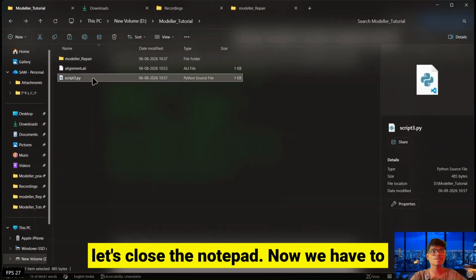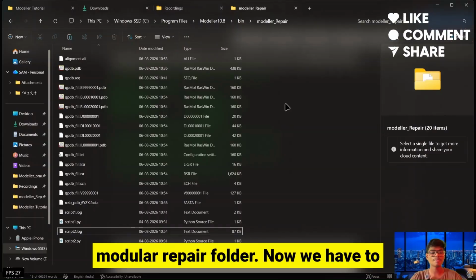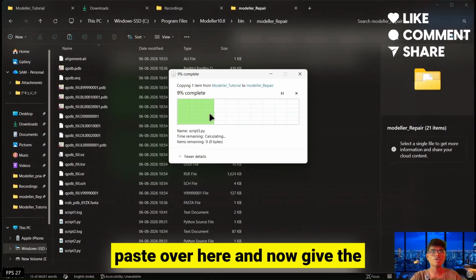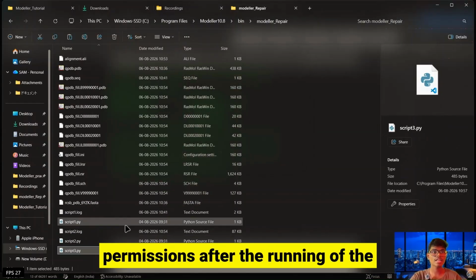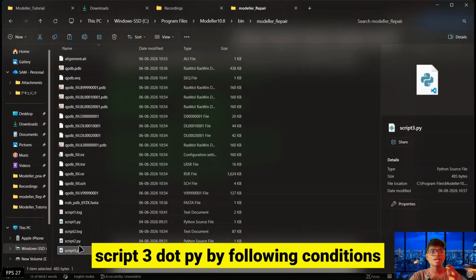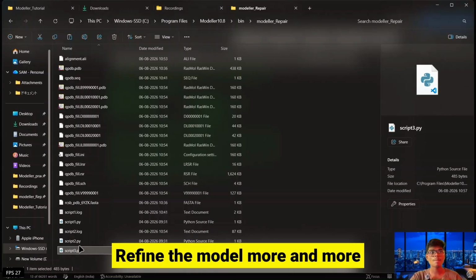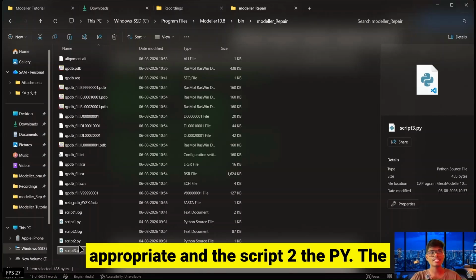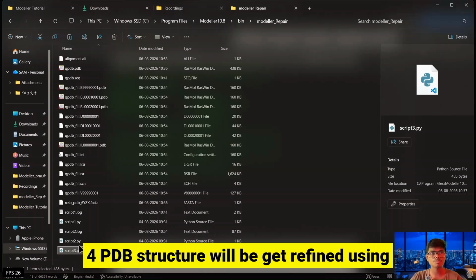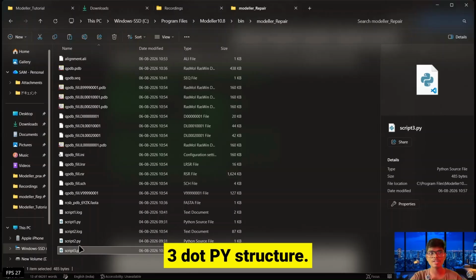Now we have to copy this script3.py file inside the modeller repair folder. Now we have to paste over here, and now give the permissions. After the running of script2, we now have to execute script3.py. The script3.py file refines the model more and more appropriately, and the script2.py 4 PDB structure will be refined using script3.py.